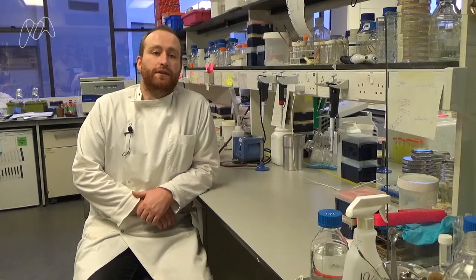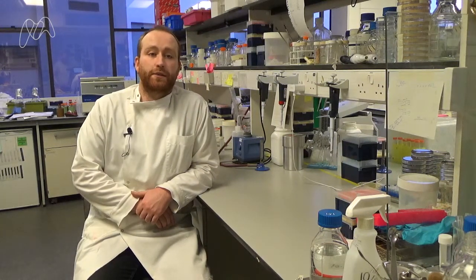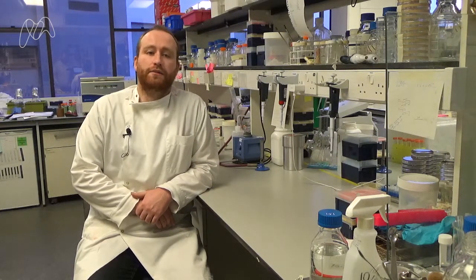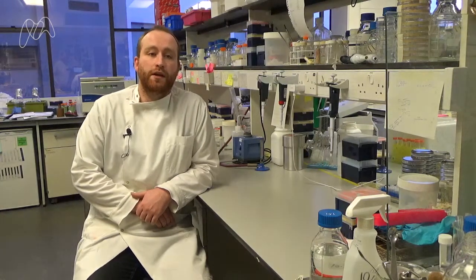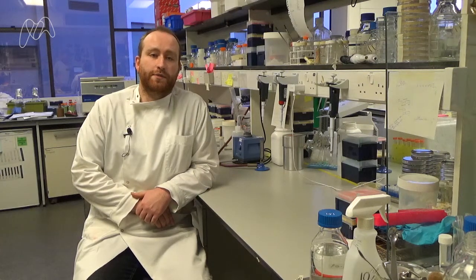Hi everyone, it's Jake. In the last video, we took the first steps towards analyzing the DNA of the bacteria that we have isolated. We did this using the PCR technique, which helped us to make more copies of a particular section of the bacteria's DNA code. This section codes for a gene which varies between different types of bacteria.